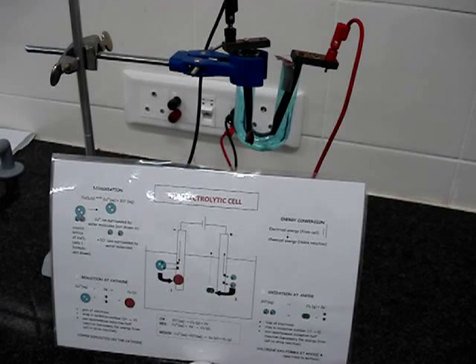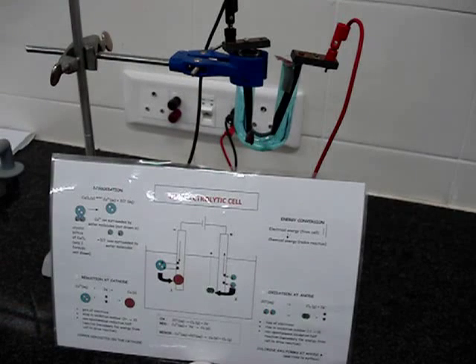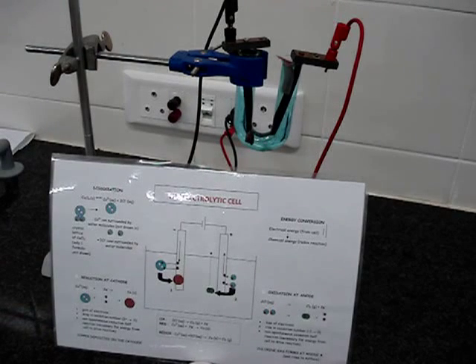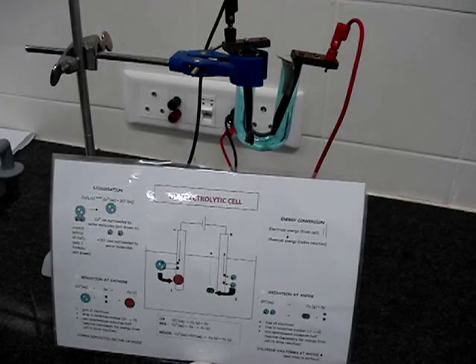Copper ions, Cu2+ ions, have been reduced to copper atoms. And we can see there, at that electrode there, that that is indeed the case. Can you see the deposit of brown copper on this electrode?